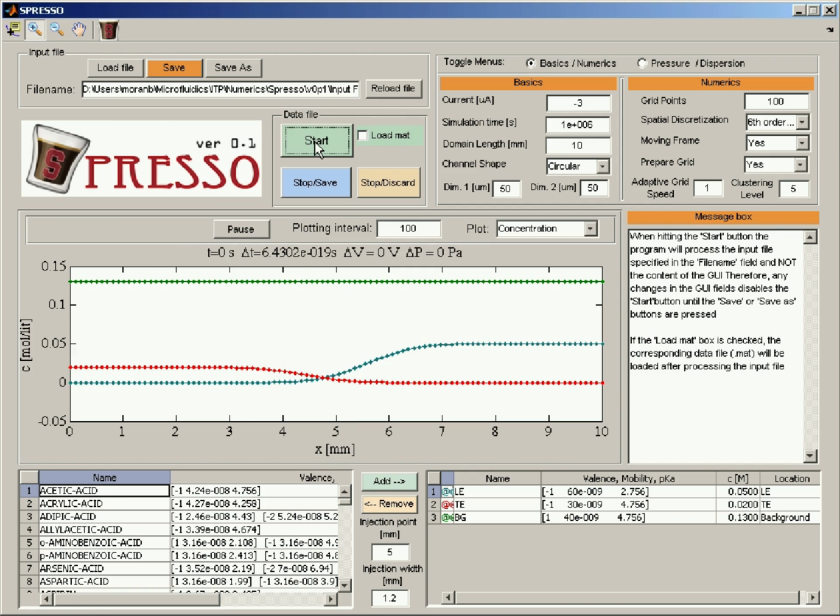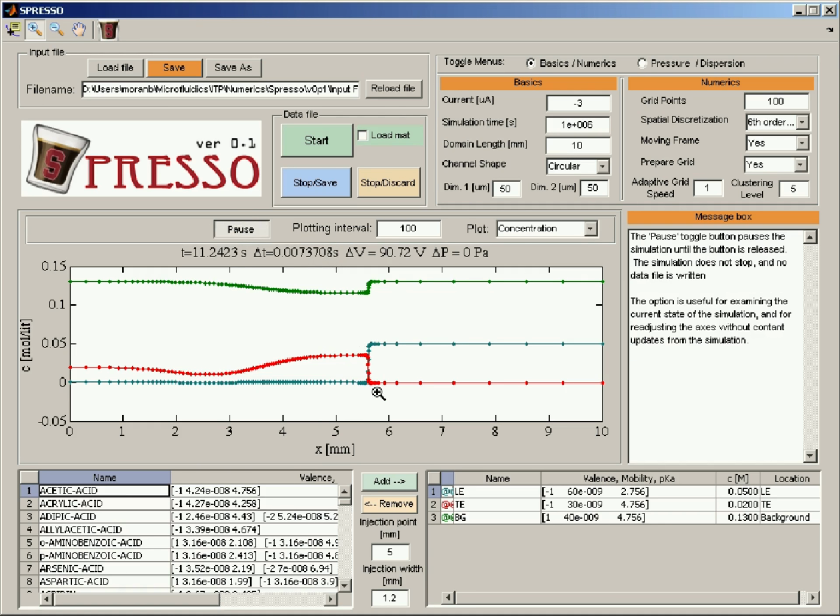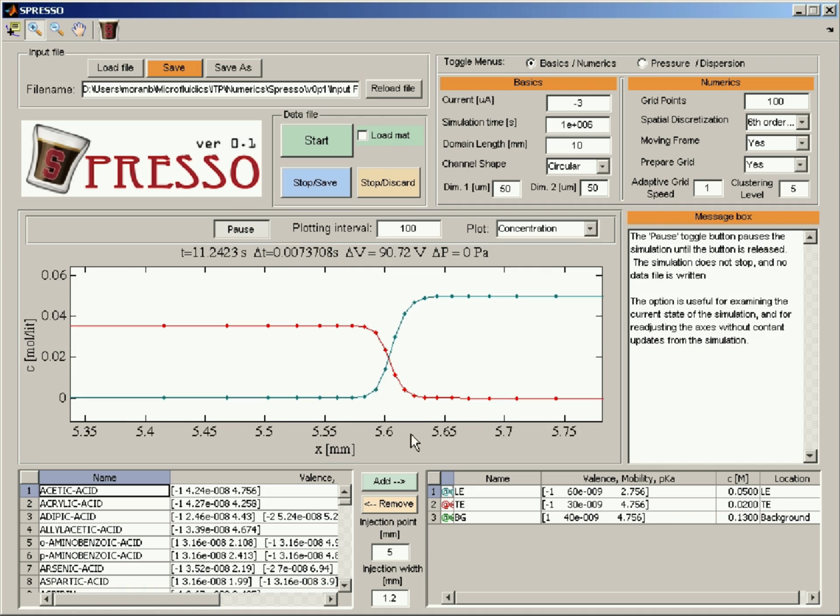Save and start. And I hope that this will solve the problem for 3 microamps. Yeah, so looks like it was very close to getting some oscillations there, but there are enough grid points now at the interface, and this works. Okay. So the interface should be now very sharp. Let's pause this. Go in again. Yeah, so you can see it's much sharper than before, about 1/3. So this is about 30 microns.